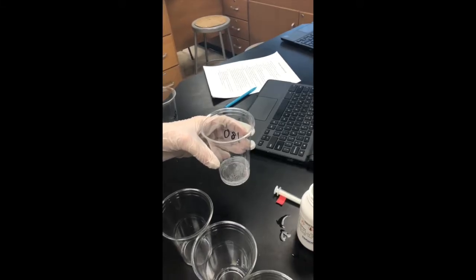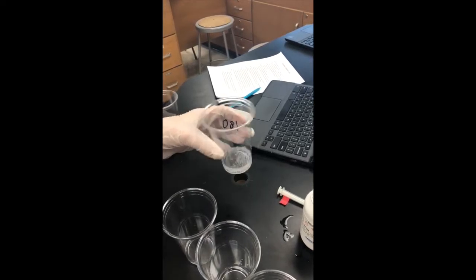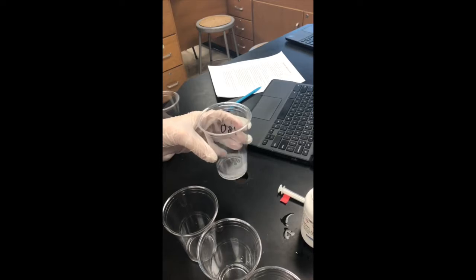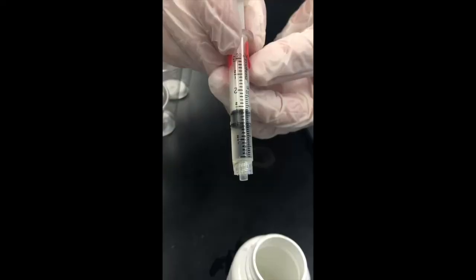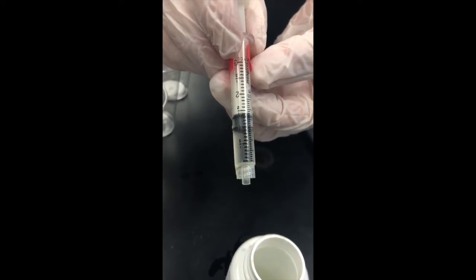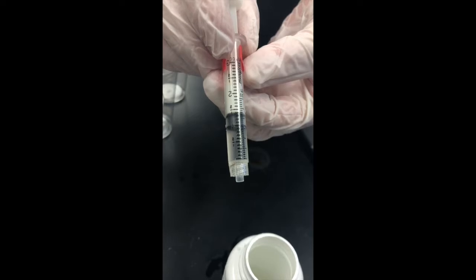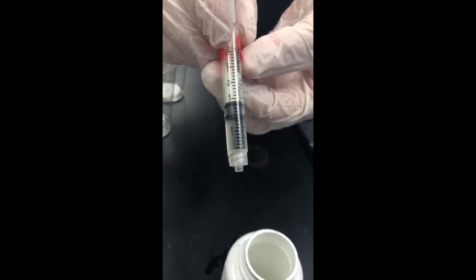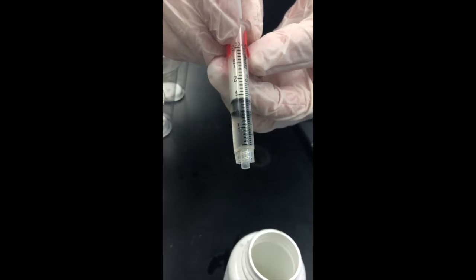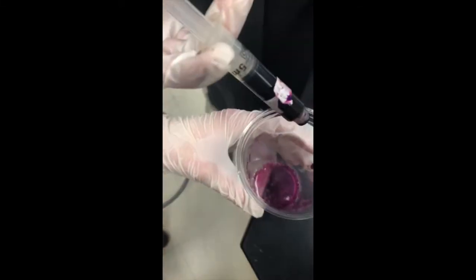A possible explanation for why these 2 intervals did not follow the trend that the majority of our data followed is due to the human errors made during the experiment. Possible sources of errors include inaccurate readings of the syringe, using the same syringe to collect all 7 5 milliliter samples of H2O2 to perform the titration on, leading to possible contamination, and counting drops of KMnO4 instead of measuring directly in milliliters.